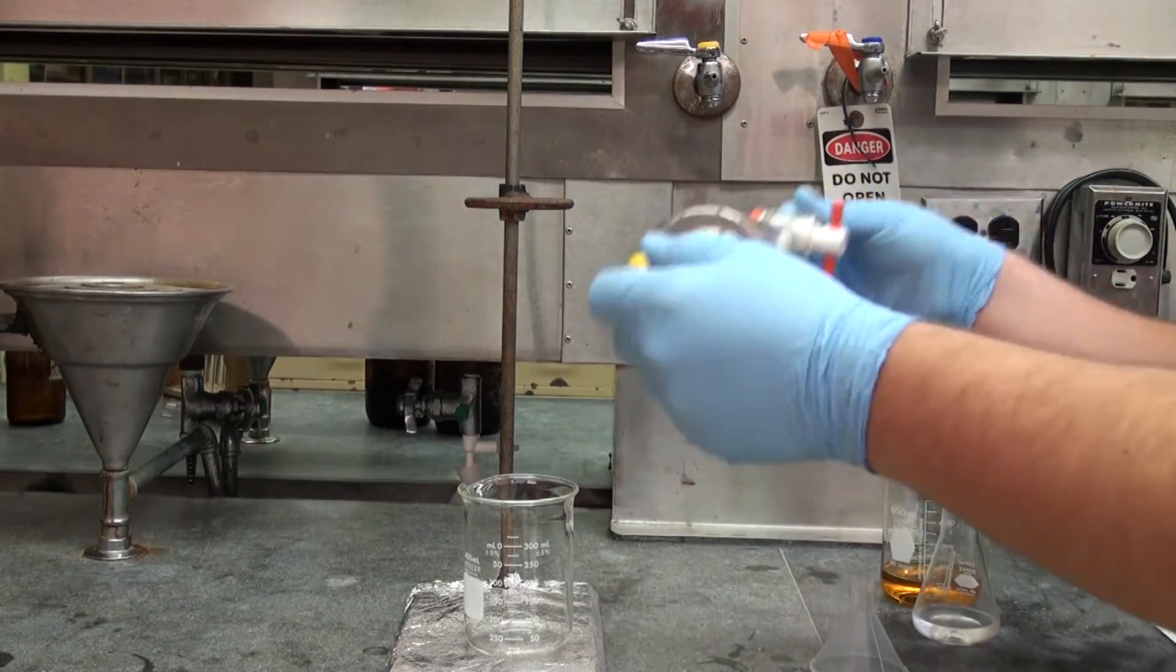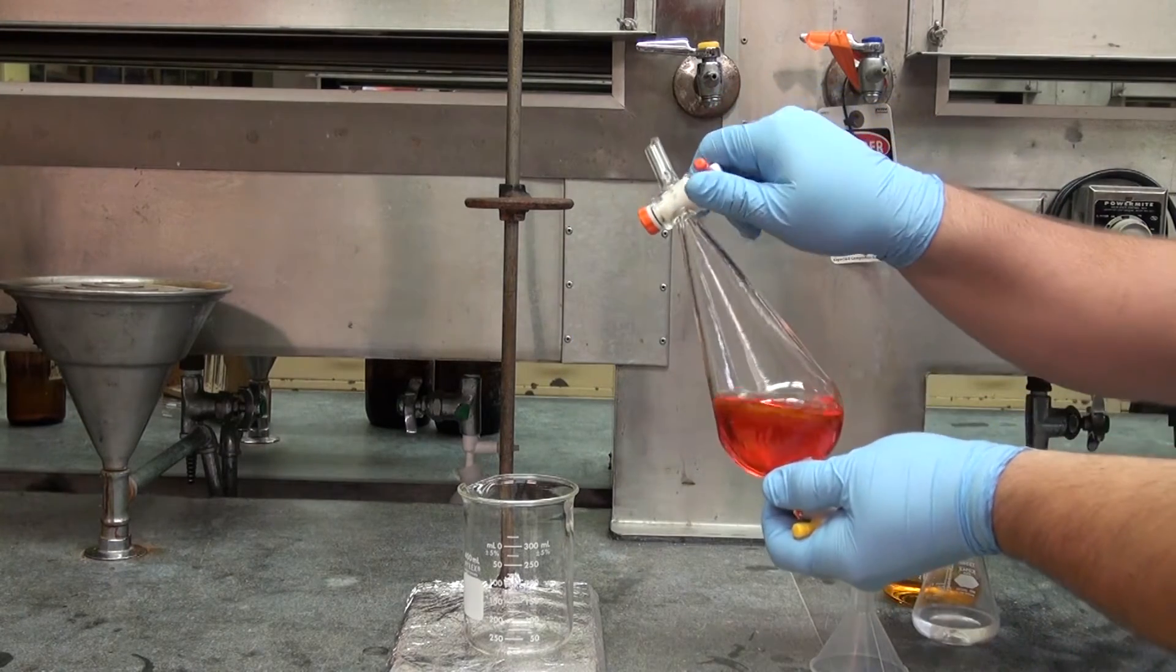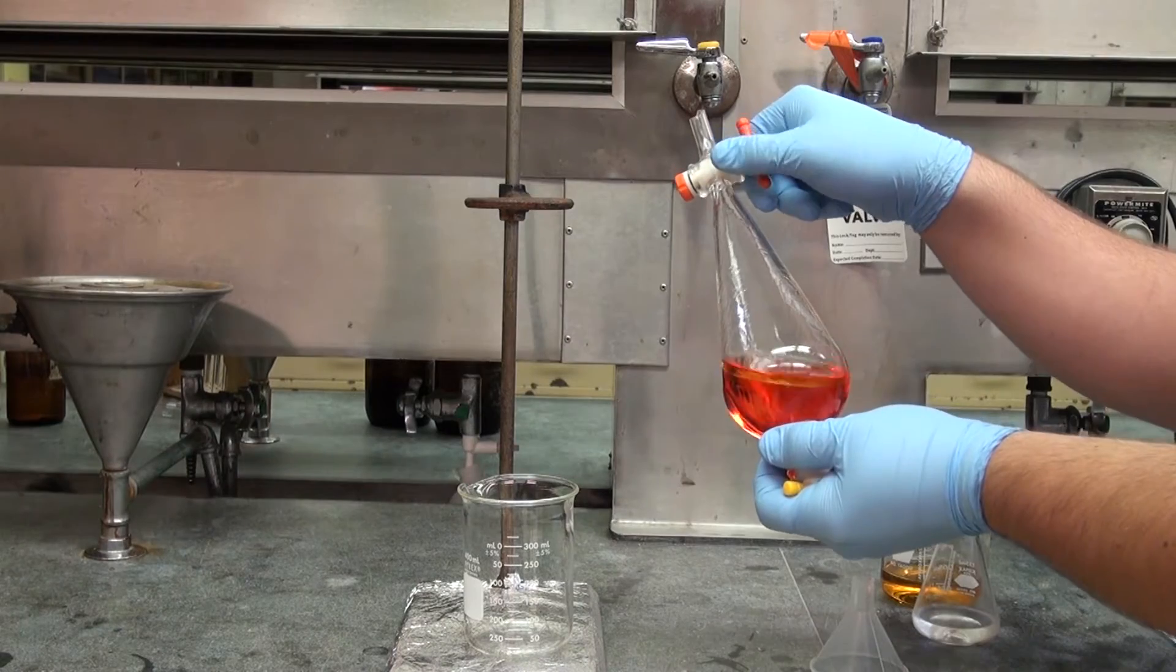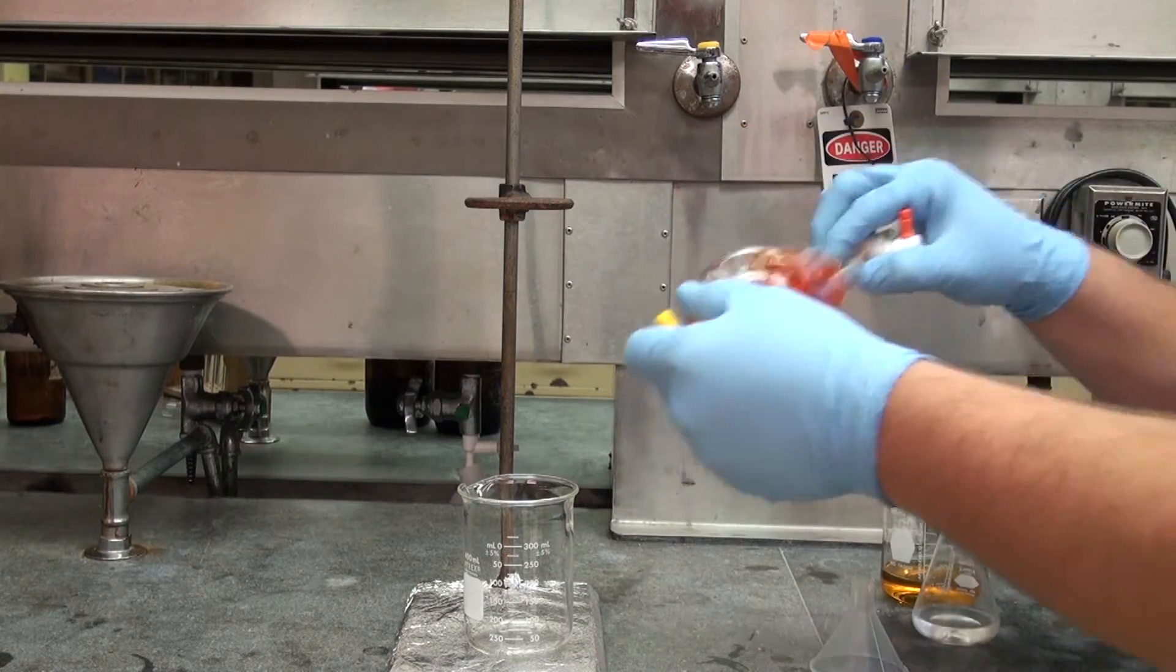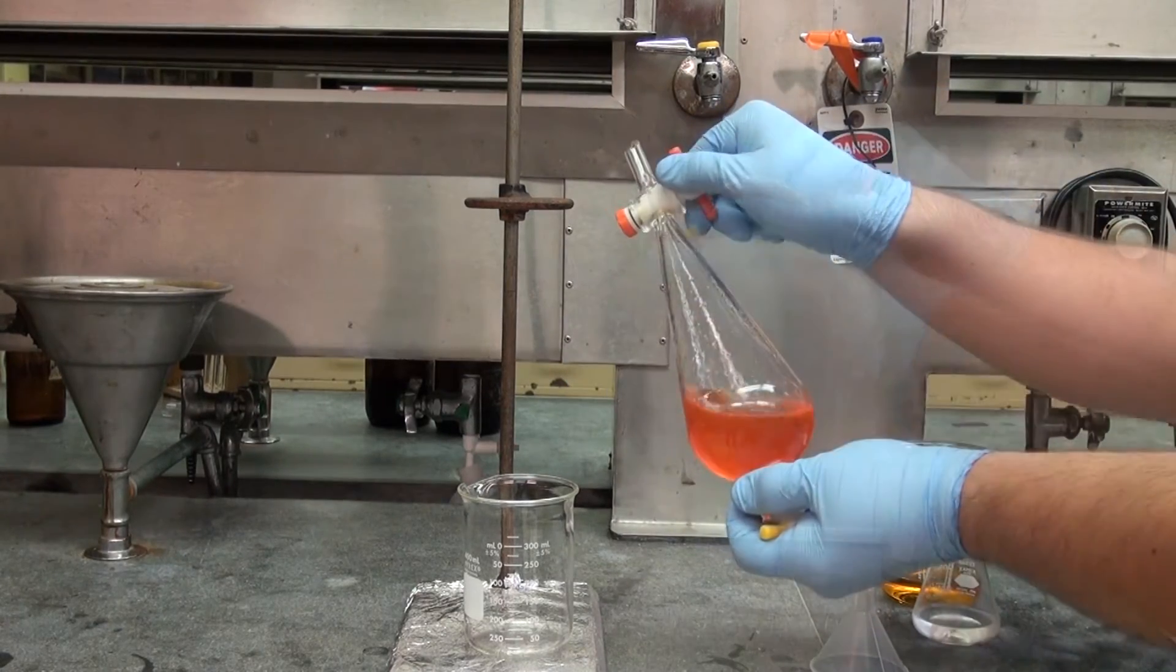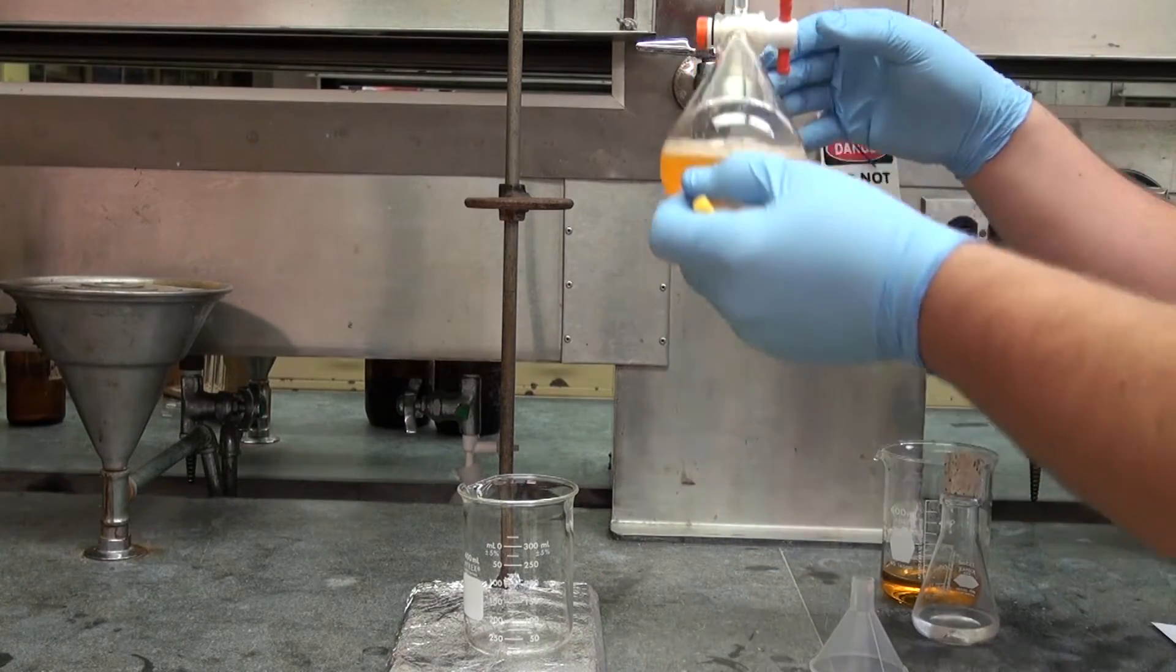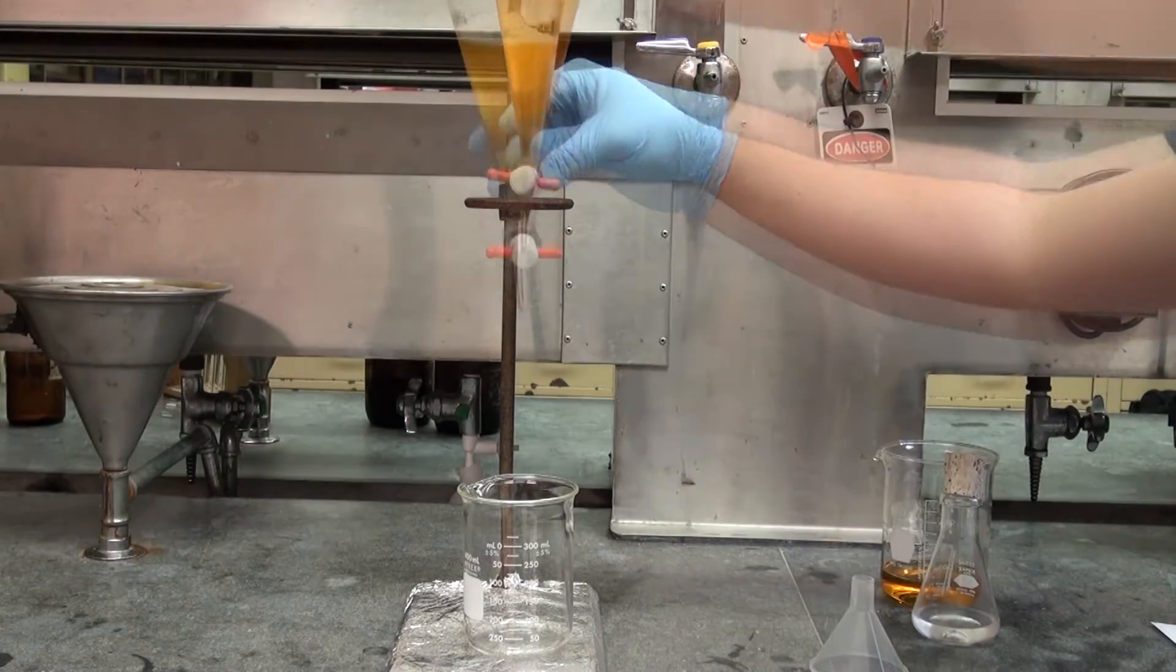In general, an extraction requires good mixing of the solvent. Make sure you open the stopcock in between. Release the pressure more often at the beginning. After a while, there will be less pressure buildup. Then you put the separatory funnel back in the stand.